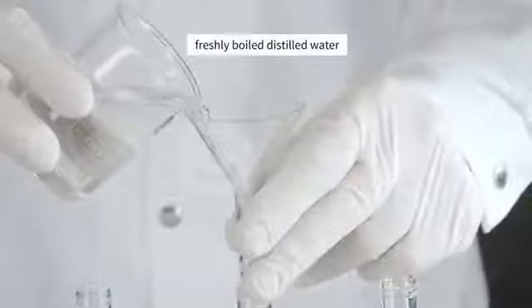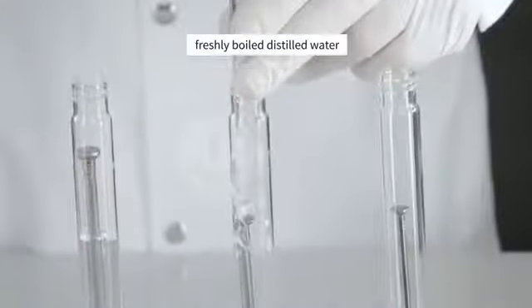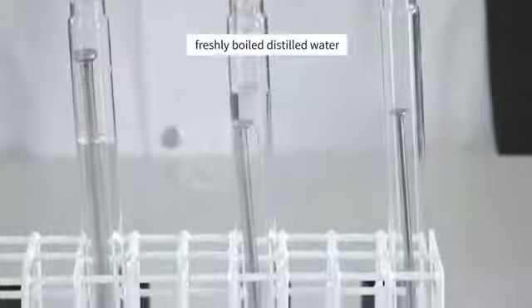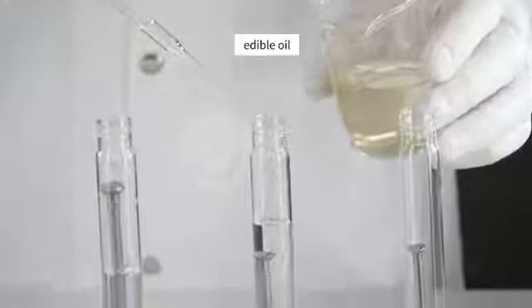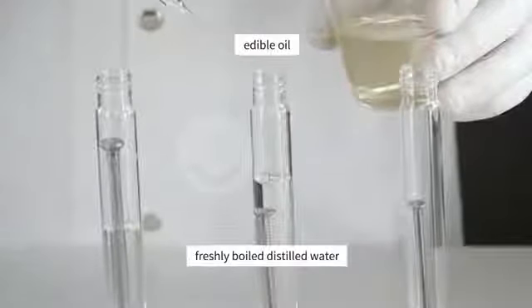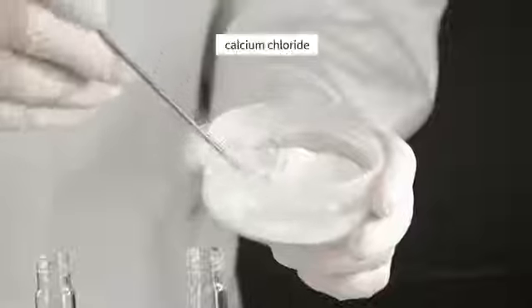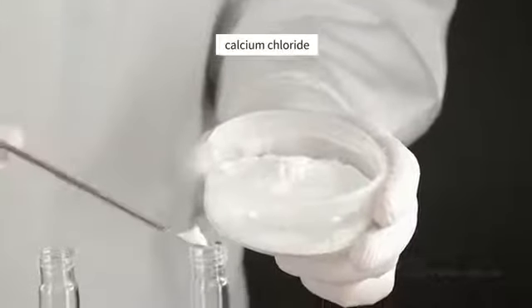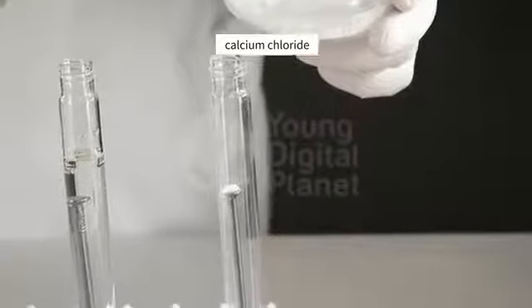We add freshly boiled distilled water. It contains less dissolved gases from the air, and a little edible oil to the third test tube. The layer of oil will prevent the air in the test tube from dissolving in the water. We add calcium chloride, which will absorb the water vapor present in the air, to the fourth test tube.